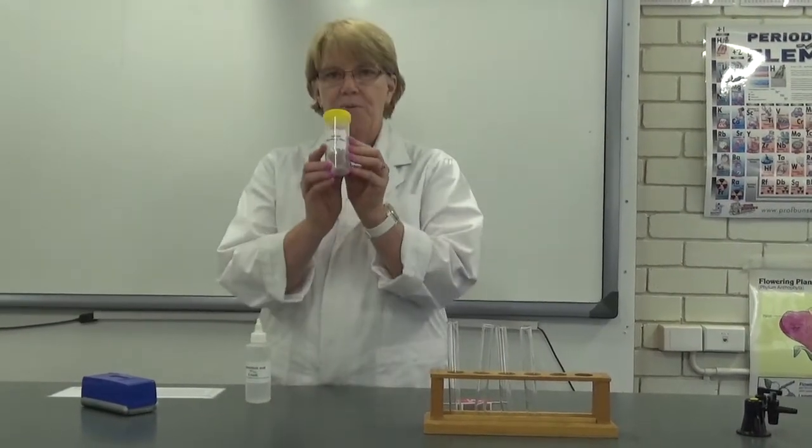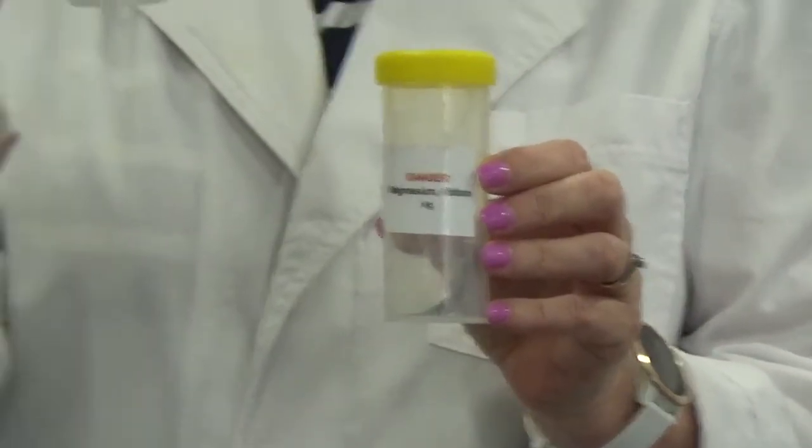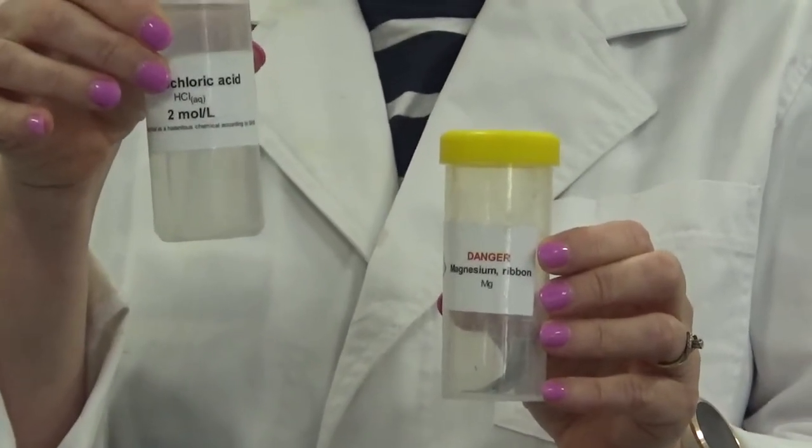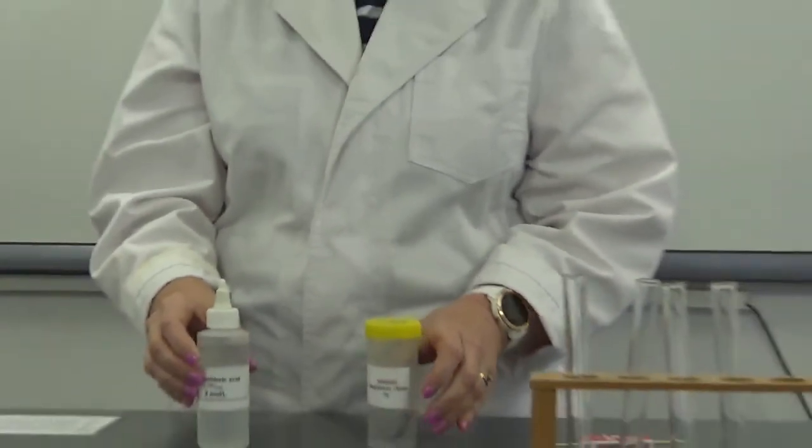Today is the reaction between magnesium ribbon and hydrochloric acid. I want you to be looking out for some of those signs of chemical change that we've been learning about, and see what you can see happening in this reaction.